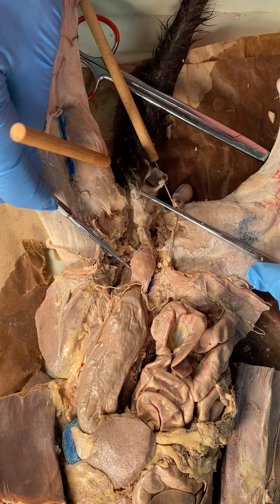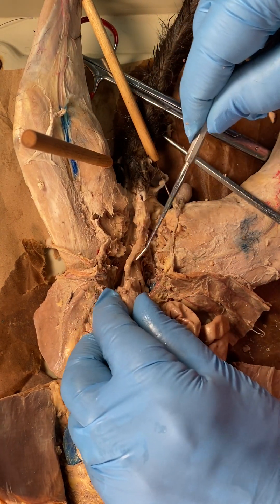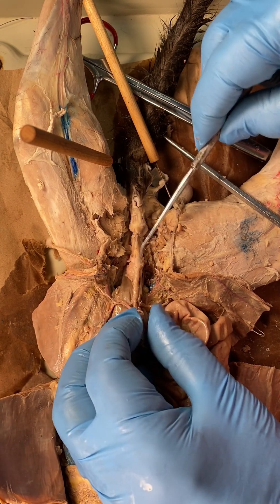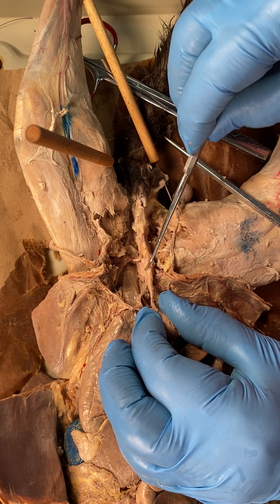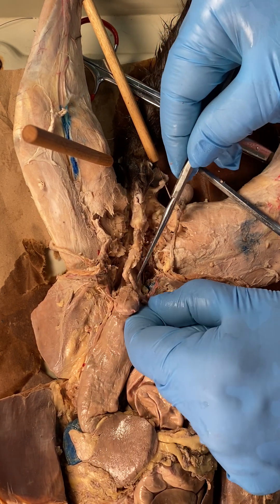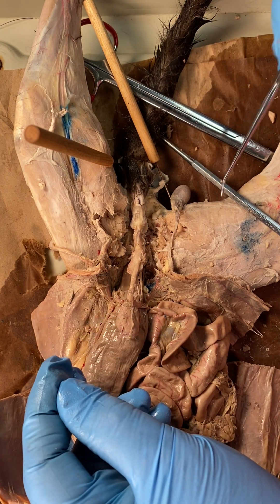Once it's posterior to the urinary bladder, it's going to descend and head straight down looking for the urethra — the posterior side of the urethra. Right there you can see the right one and the left one. What's it looking for? It's looking for the prostate. There's the swollen area of the prostate, with the left vas going in from the left side and the right vas going in from the right side. You can follow it all the way from the testes, looping around the ureter, into the prostate. That is the reproductive system of the male cat.